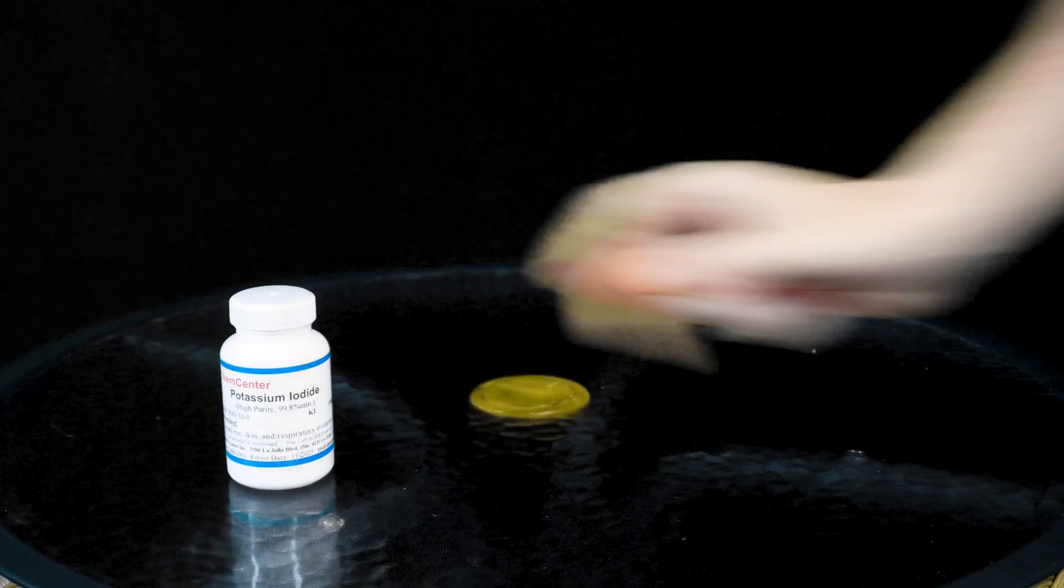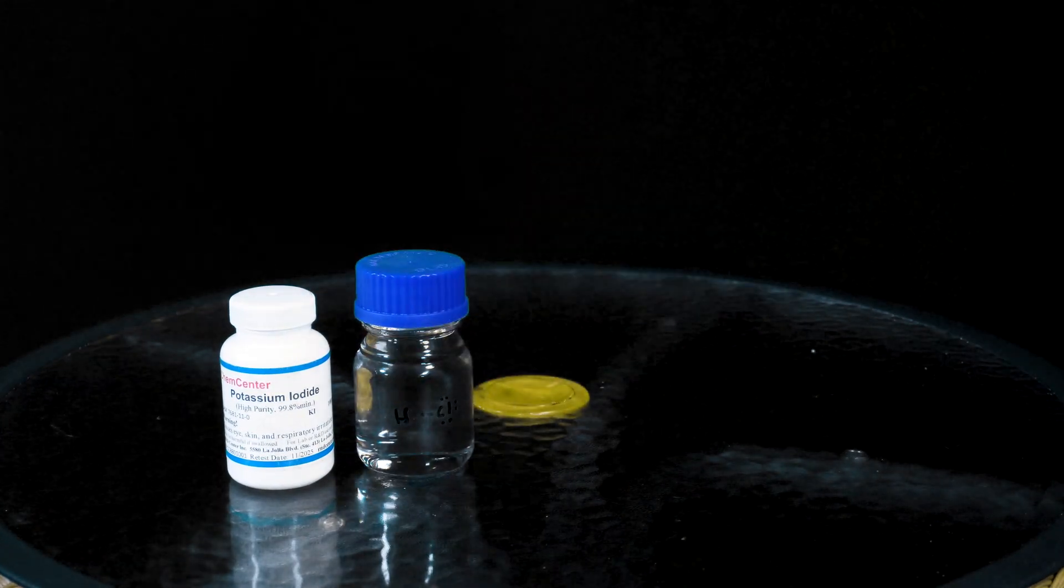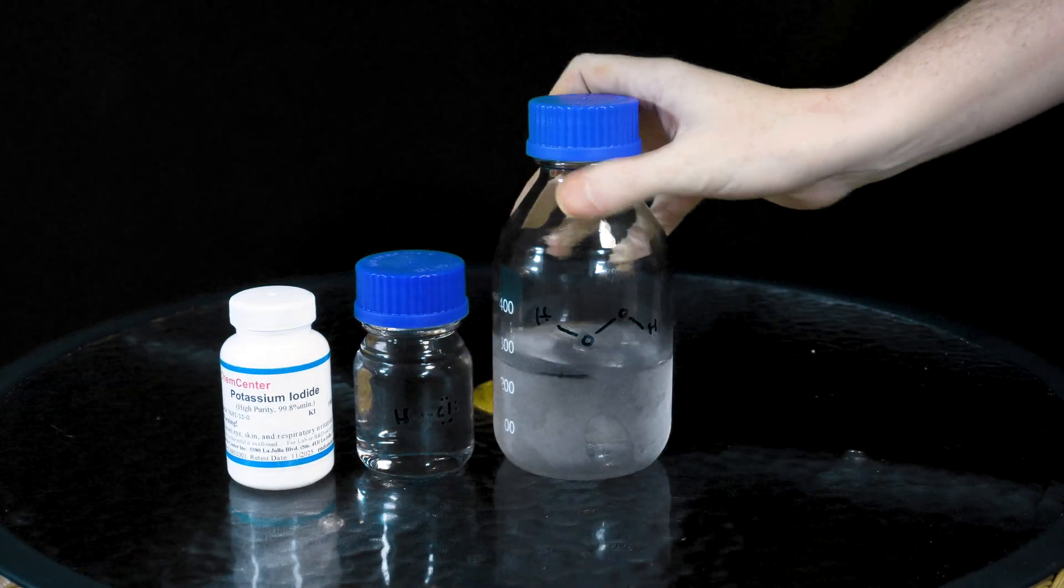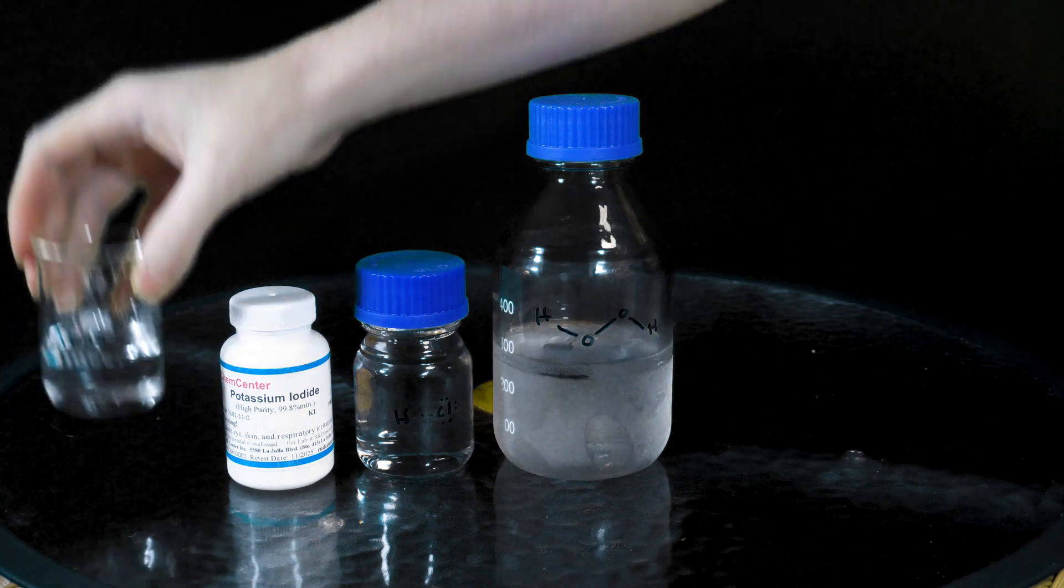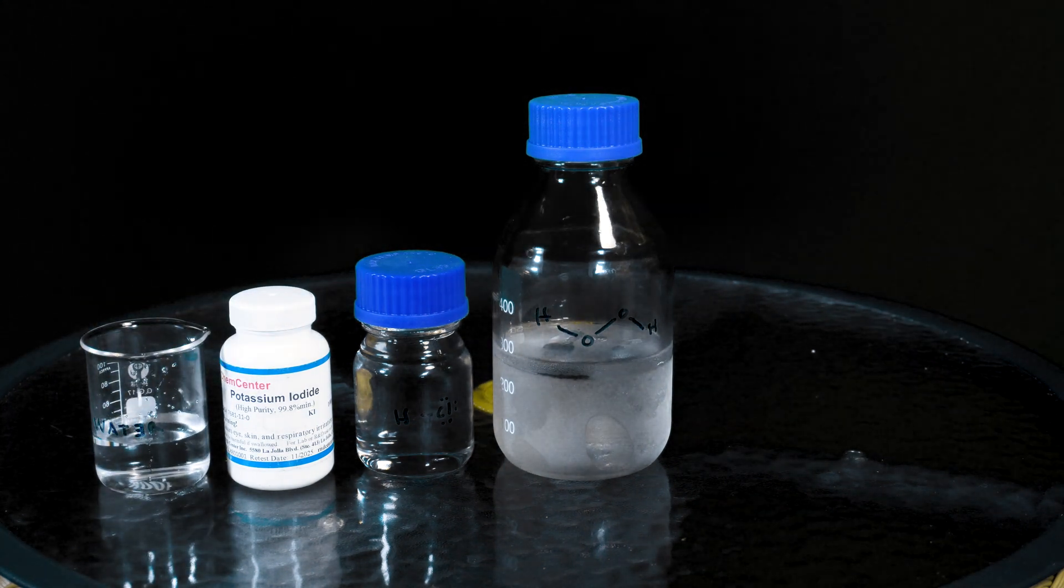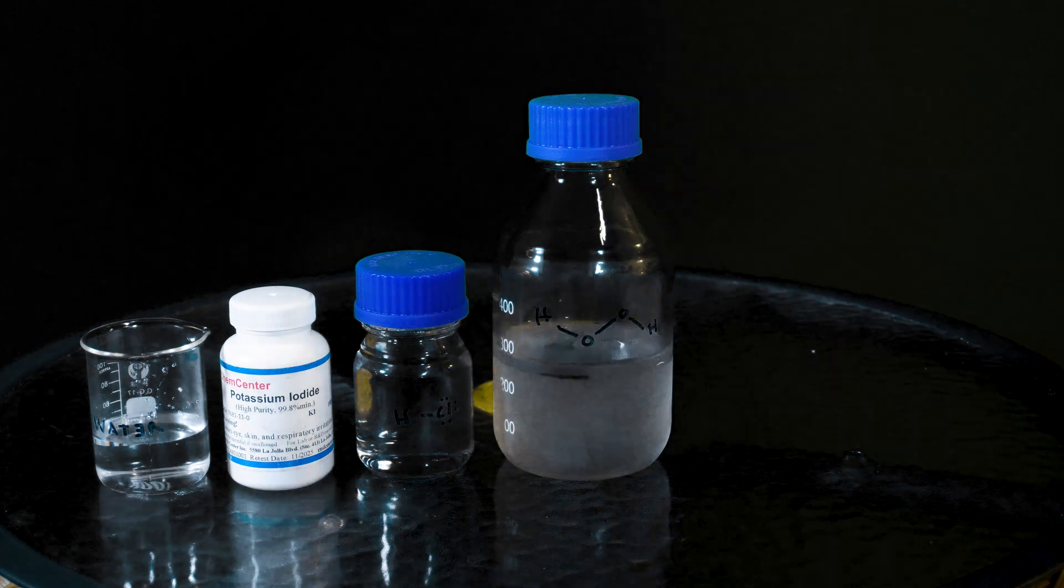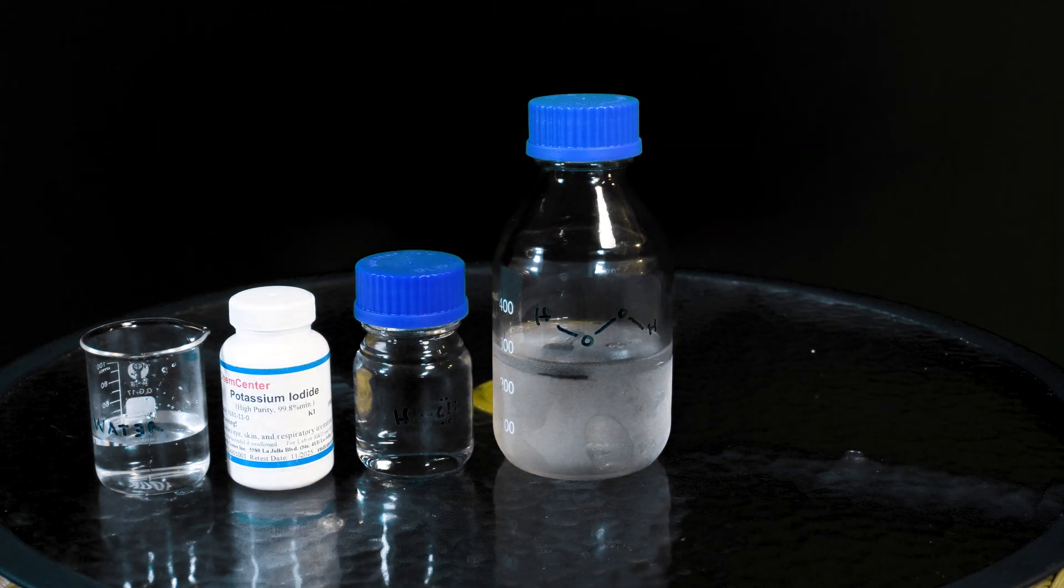All we need for this process is some potassium iodide, hydrochloric acid, 34% hydrogen peroxide, and some water, all of which can be obtained from your local hardware store and your favorite terrifyingly massive corporation, Amazon.